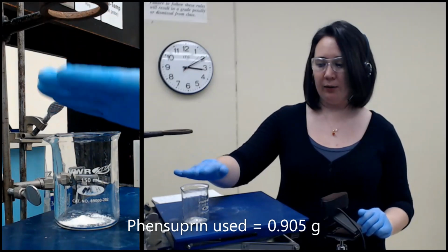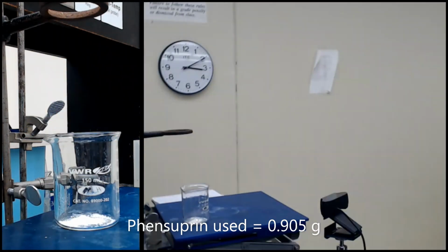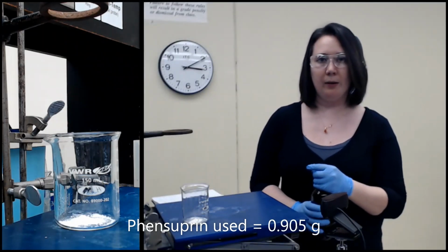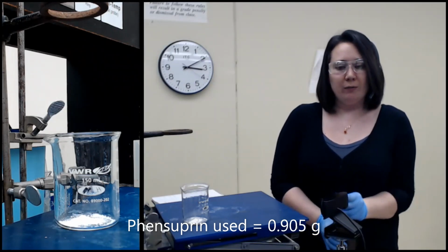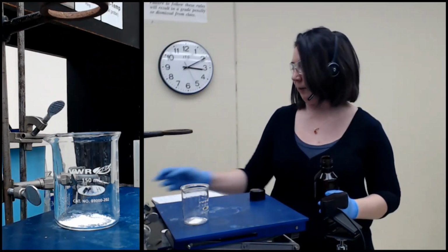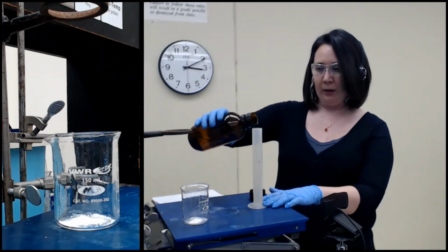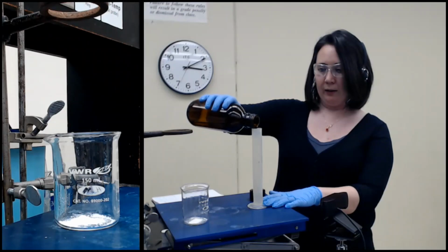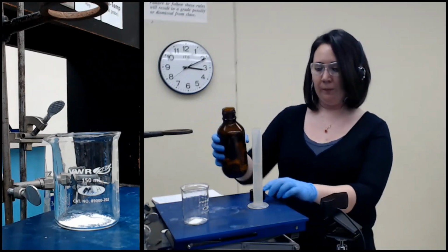So step 1 is to add our organic solvent right over here. And if you have looked at the Sneeden file as well as the additional lab procedure that I gave to you guys, you will note that there are 2 different solvents used and a couple differences in the amounts. So I will give you guys my notebook so that you can see precisely what I'm doing today. But I have decided to switch from dichloromethane, which is in the original Sneeden file, and today I'm going to be using ethyl acetate.